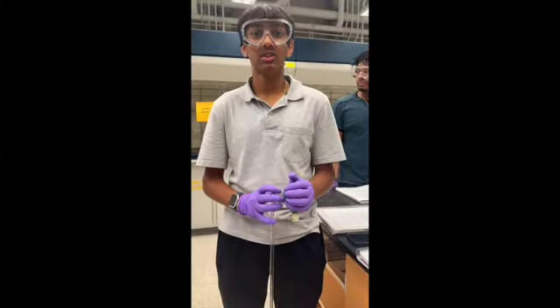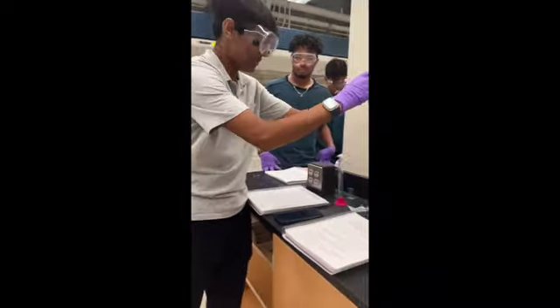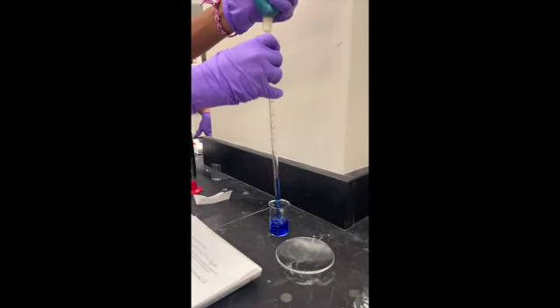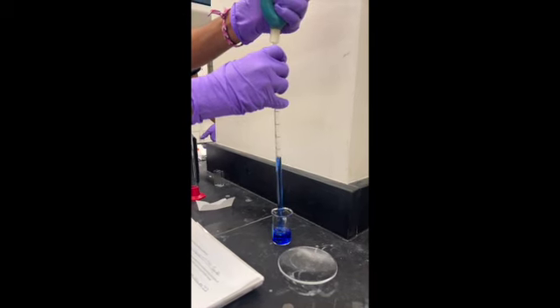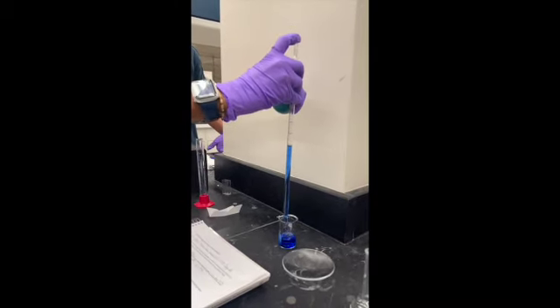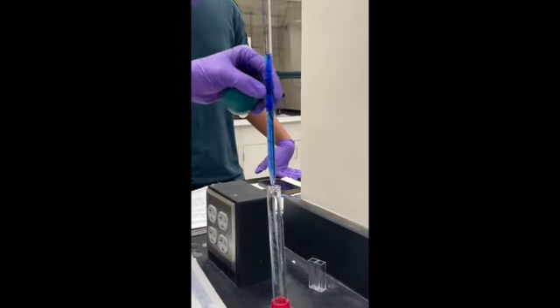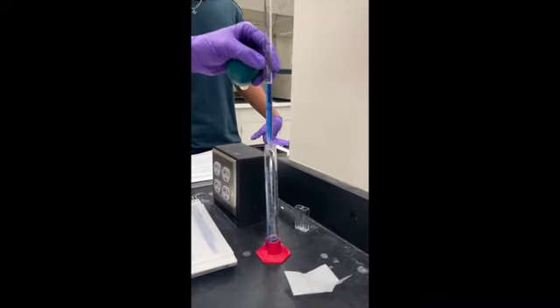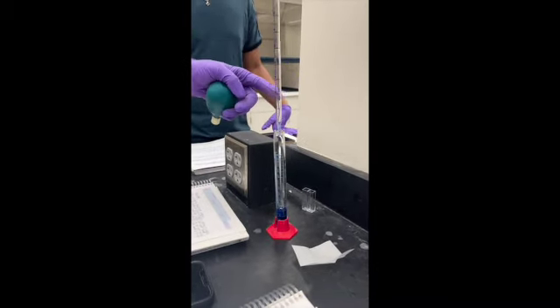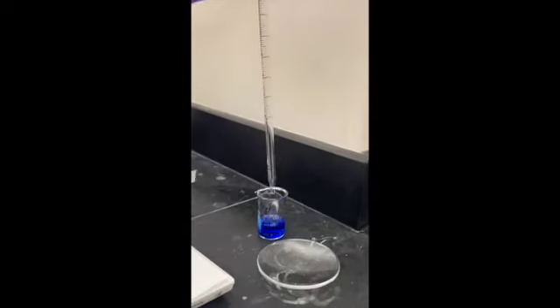Now we will be transferring the stock solution into our volumetric flask for our first dilution. We need 12.5 milliliters, so we will prime the bulb and take out 9 milliliters. Okay, that's fine. So this is for the stock. We take out any air bubbles, and then we transfer it to a graduated cylinder. Did you read it? I'll go again. That was 7 milliliters, which means we need another 5.5.